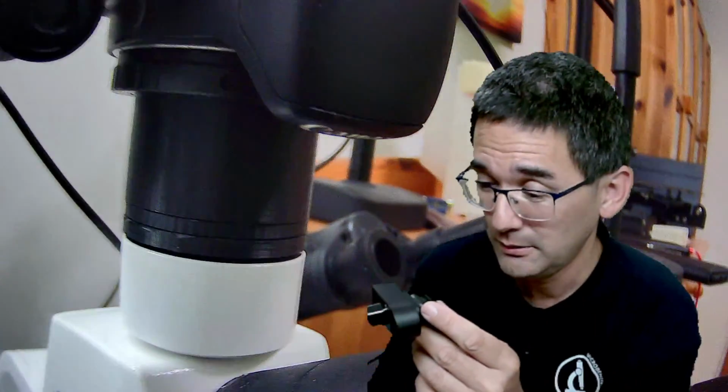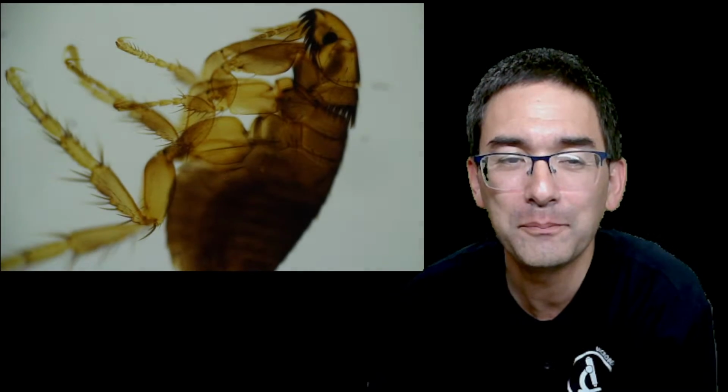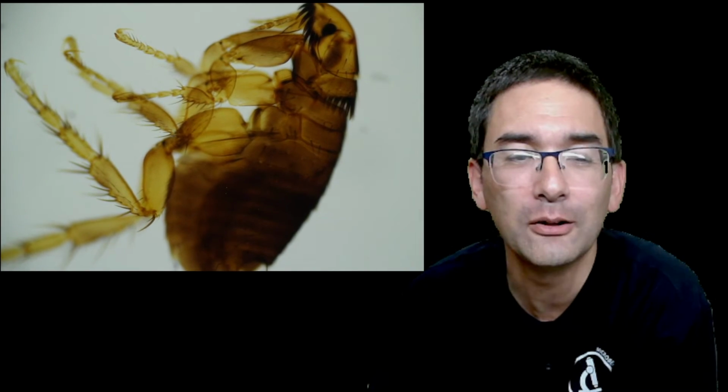And let's have a look at this. This is now the 200D. Does the camera work? Maybe I have to turn it just a second. I have to activate it again. I hope that this works. I have to also switch on the microscope, of course. Maybe I don't see anything because the microscope is turned off. Okay. So this is basically the view that I get directly into the DSLR camera.